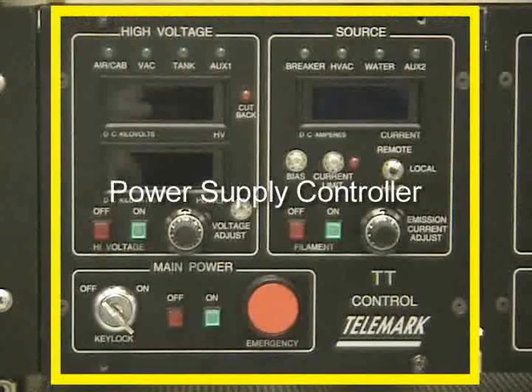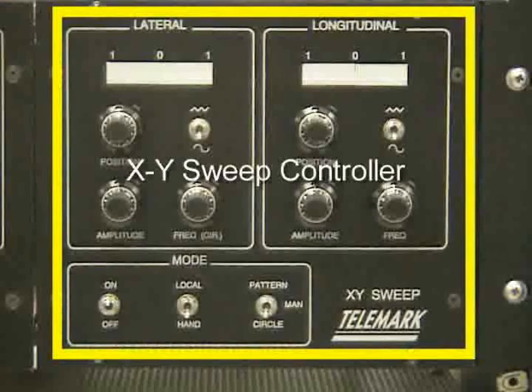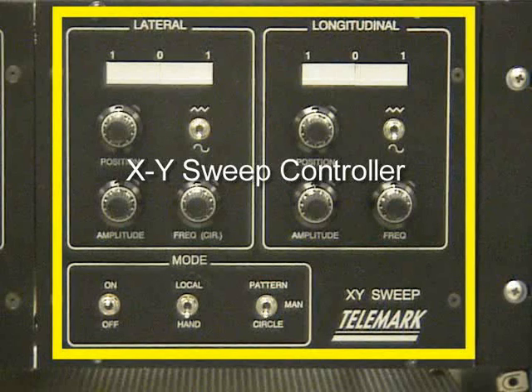The power supply controller controls the electron beam power supply. The XY sweep controller controls the position of the electron beam. For proper operation, the beam must move in a circle inside the crucible. The beam should not touch the edges of the crucible.